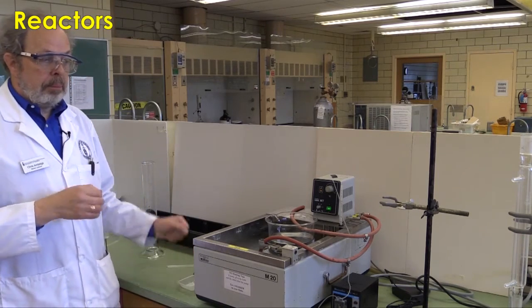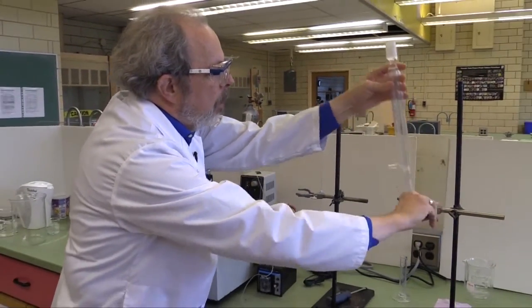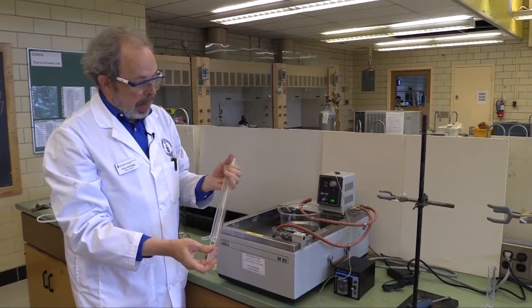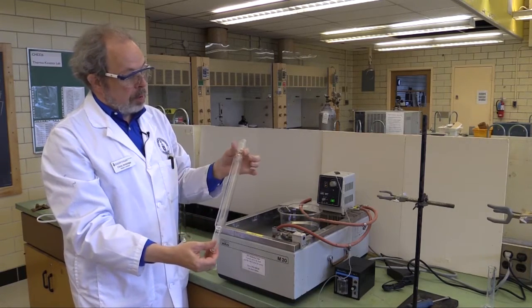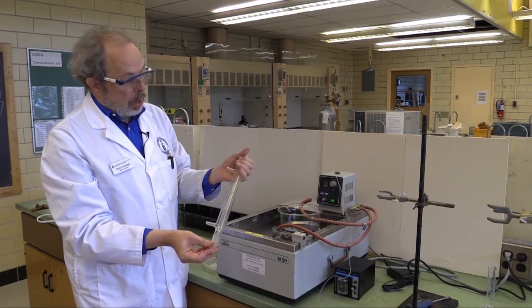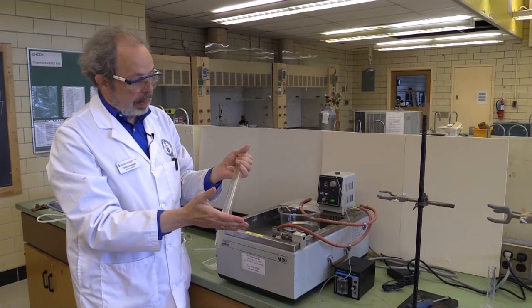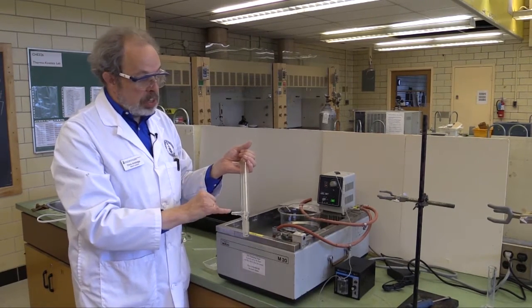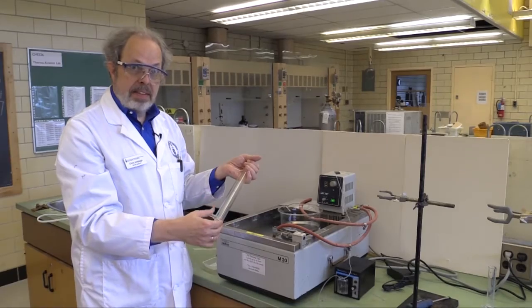We are providing you with two reactors. They're both condensers, and this one you're going to be filling. The two of them have slightly different central cores. One is narrower than the other, but this is normally a condenser. We will fill it an appropriate amount with the catalyst, and then the water jacket, which is normally used to keep it cool, we're going to pump 60-degree water through it so that the entire reactor is also at 60 degrees.